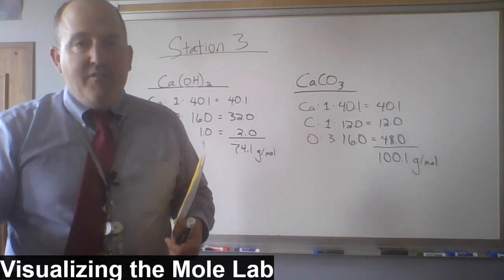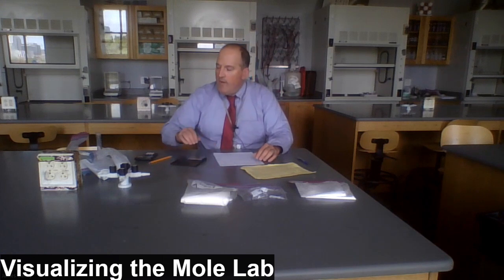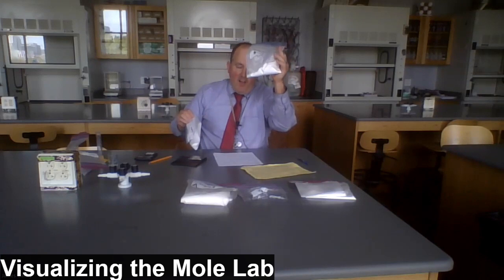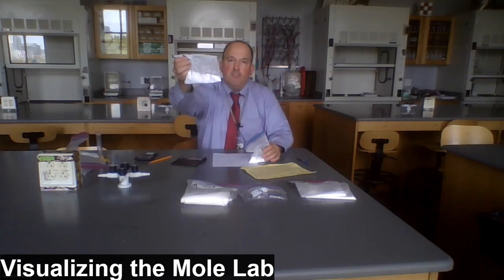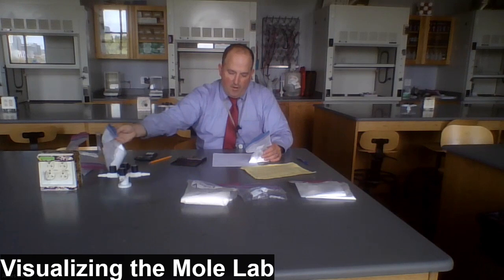And that'll enable us to identify which one's which in station 3. Okay, so now that we've established the molar masses for both calcium carbonate and calcium hydroxide, which sample, the one that weighed 100.4 grams or the sample that weighed 75.5 grams, do you think the calcium carbonate was? Well, of course, calcium carbonate's calculated molar mass from our board work is 100.1. That's very close to the measured mass of 100.4. So sample A is calcium carbonate.